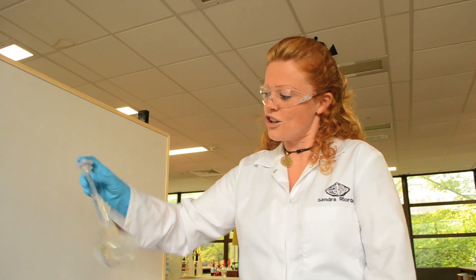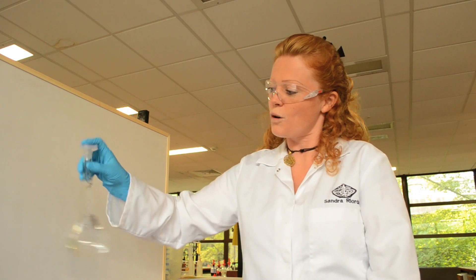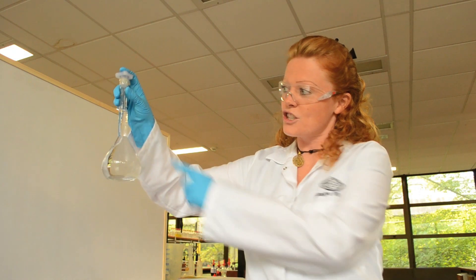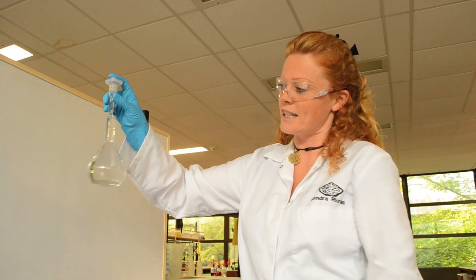Shaking the flask or swirling it will not give a homogeneous solution because of the shape of the volumetric flask, because of the neck.